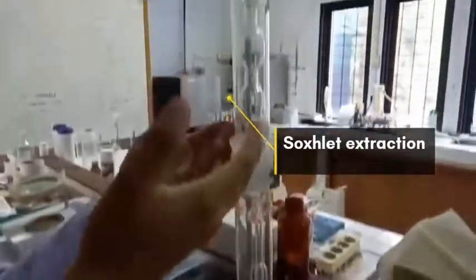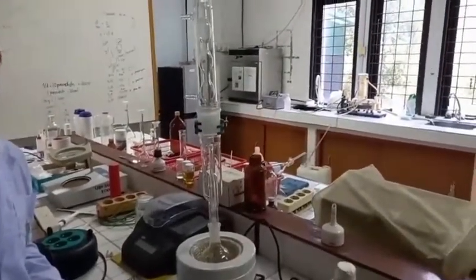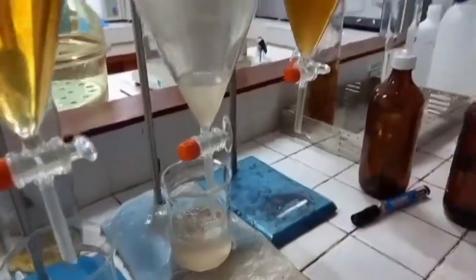There are three main types: air-cooled, evaporative, and water-cooled condensers. A separatory funnel is used to separate immiscible liquids.